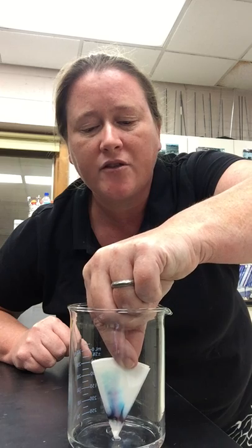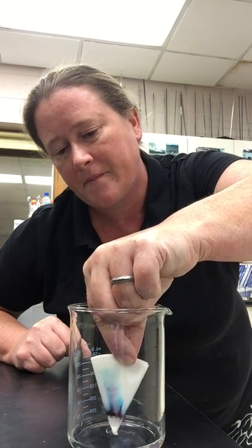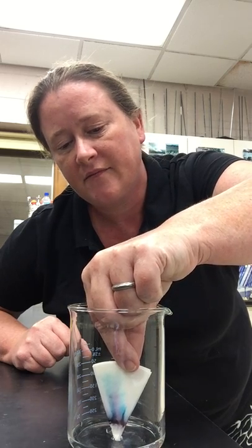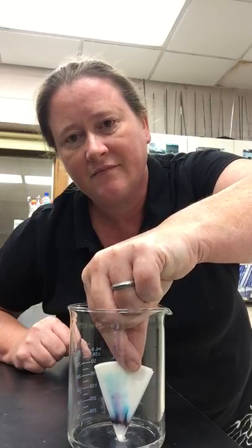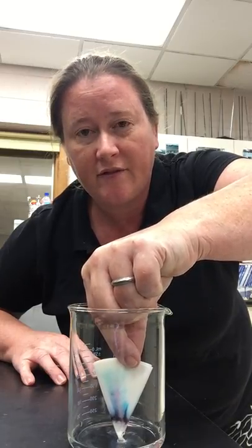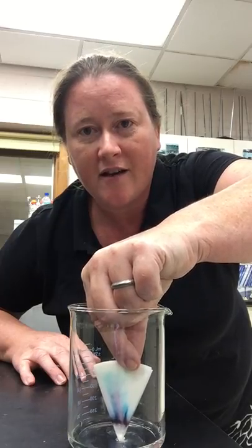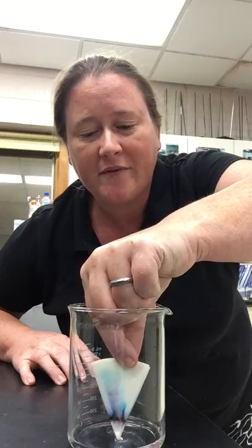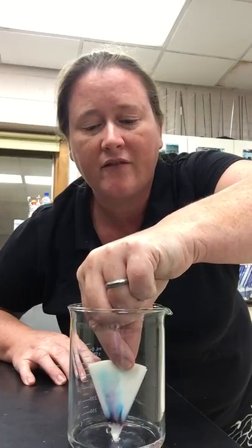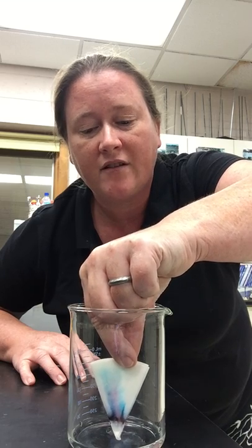I have not used this skinny marker before, so I'm not really sure what kind of end product it's going to show. I can't say I'm particularly impressed so far, but let's just wait and give it a see. I'm just making small talk as I'm waiting for this to keep going.